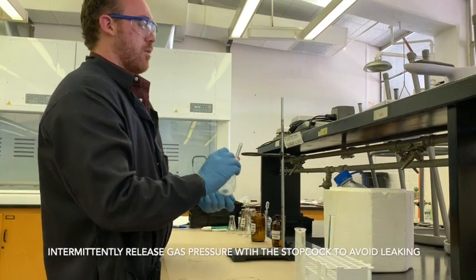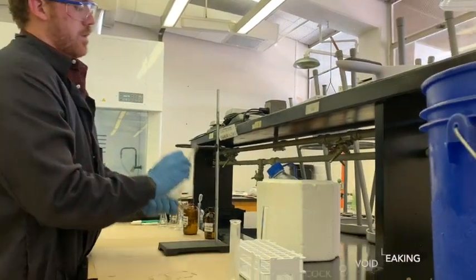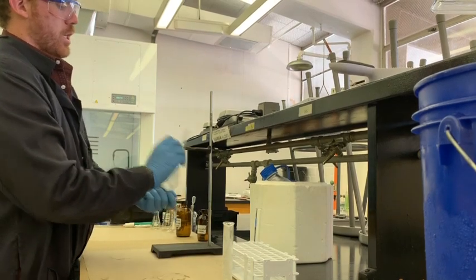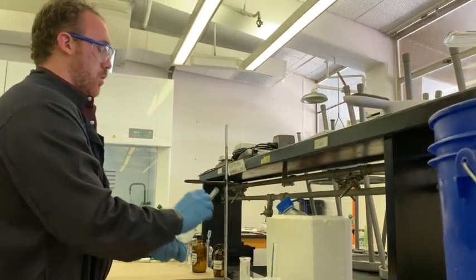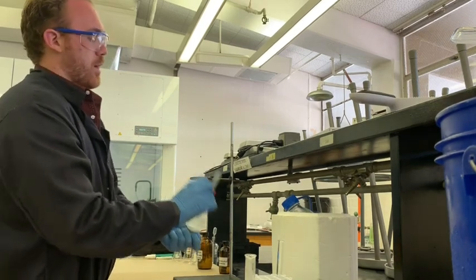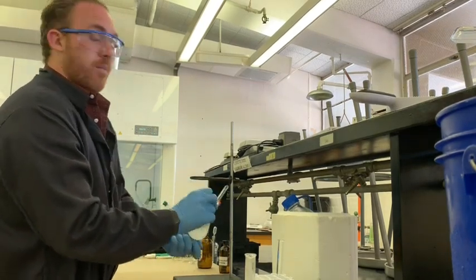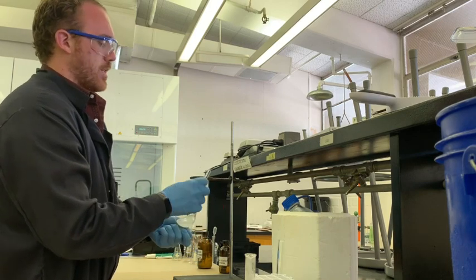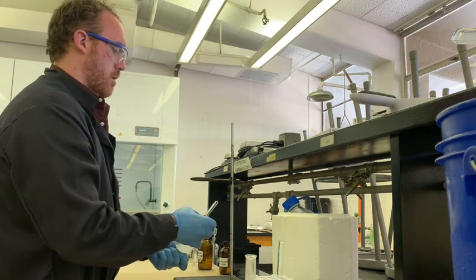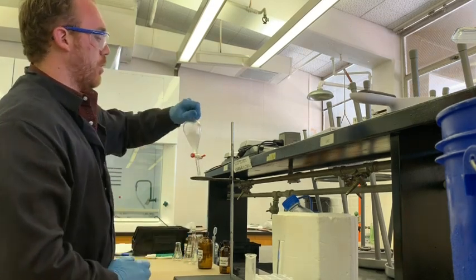So you want to be always releasing gas from your separatory funnel as you shake it. Because if you don't it can build up pressure and especially if you have a mixture like this in here it can drip onto your hand and that is not something that you really want. You don't want 12 molar hydrochloric acid on your hand most of the time. I know that I don't.